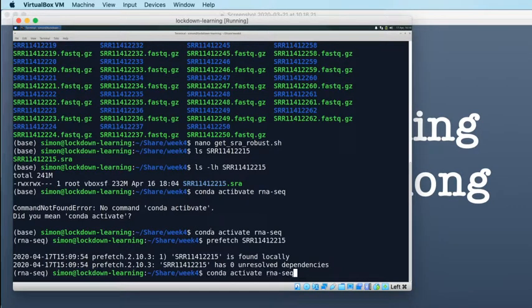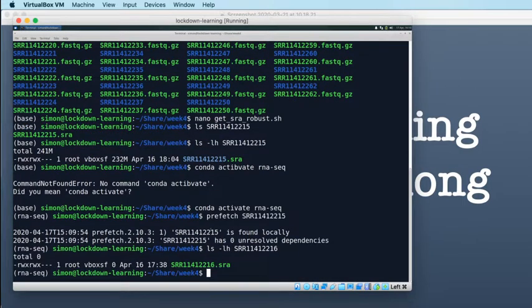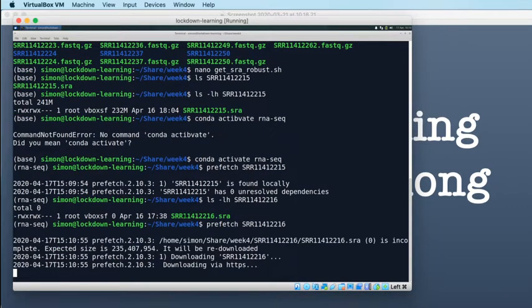If we look at the next one, so let's look at 1.6, because I went through and I touched all these files. So the SRA file here exists because I've created it with touch, but it's empty. So this clearly isn't the file that Prefetch would download. So if I then prefetch 1.6 rather than 1.5, what you'll find will happen this time is it checks, it looks at that file and says it's 0 bytes, so it's incomplete. The expected size is 235,407,954 bytes. It will be re-downloaded. So it realizes that the file isn't the size it should be, and it will go and re-download it for you.